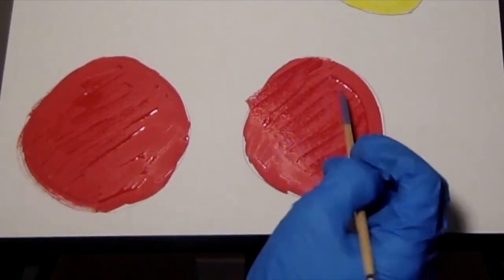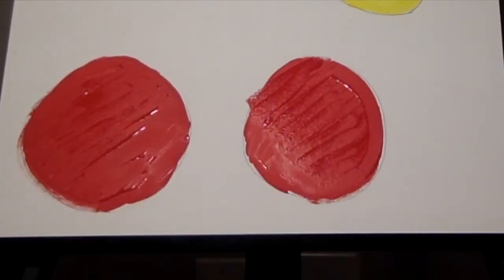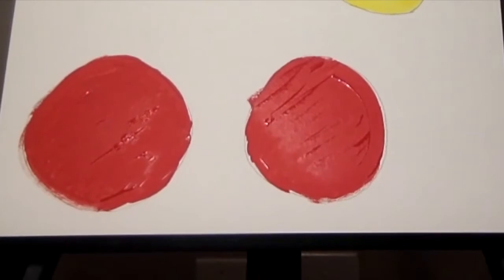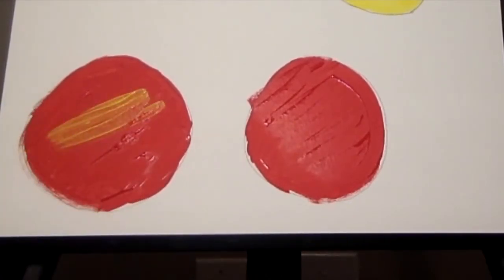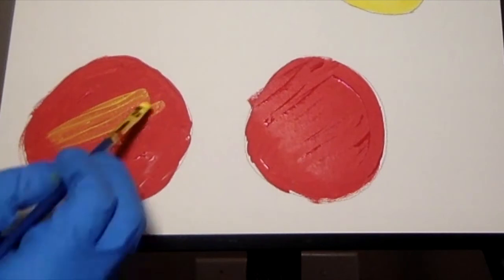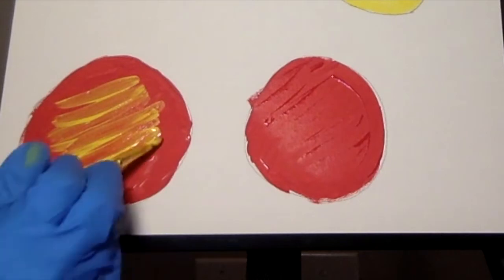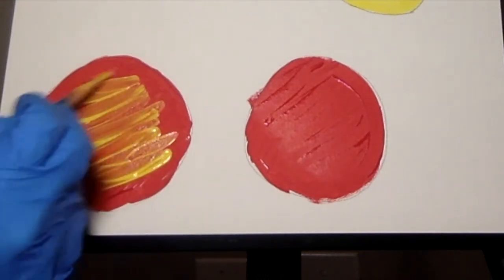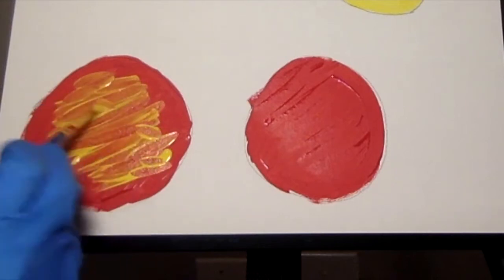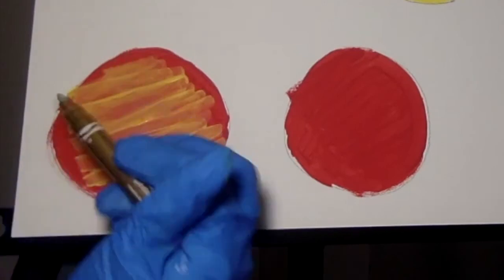You'll start to see that the media and the colonies of bacteria on the left, the S. aureus, will change color into a yellow. This is because the mannitol media is differential in that when S. aureus metabolizes the mannitol in the media, it changes the color of the media and the S. aureus colonies.